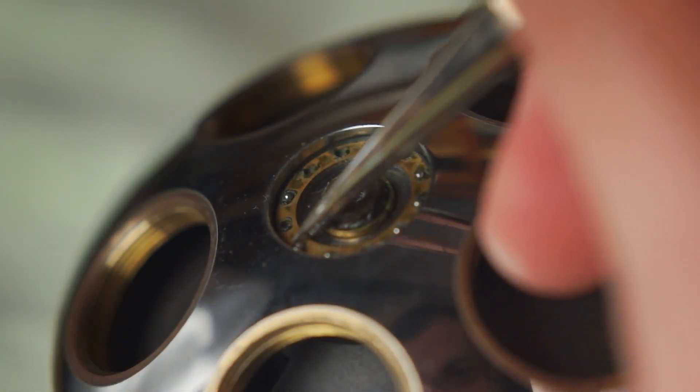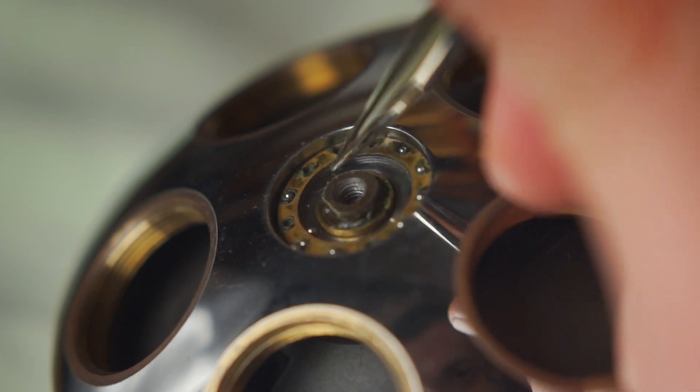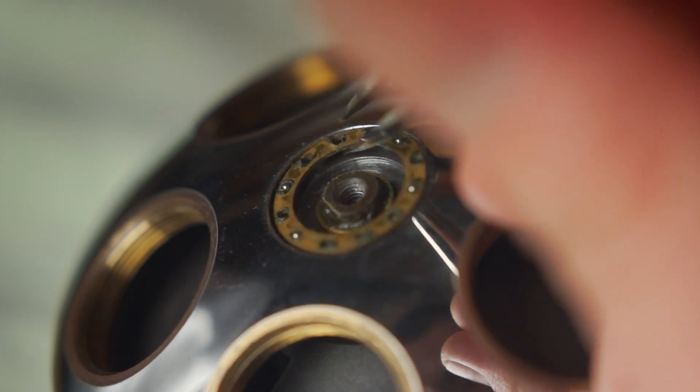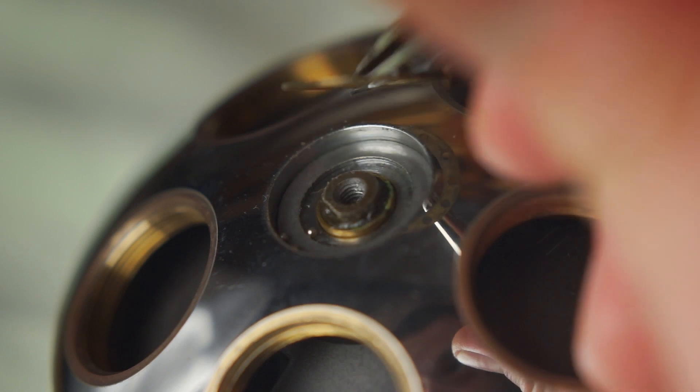With the ball cage now free, we remove it. Note that I did not pay close attention to the balls, since I will be replacing them with new ones.